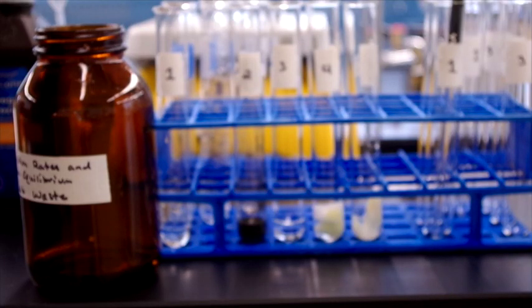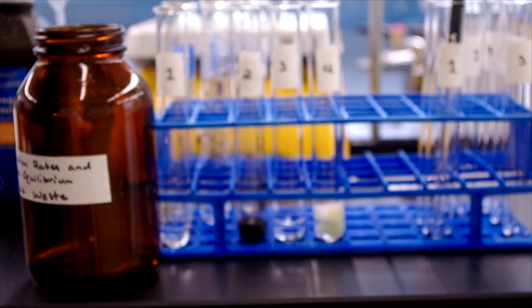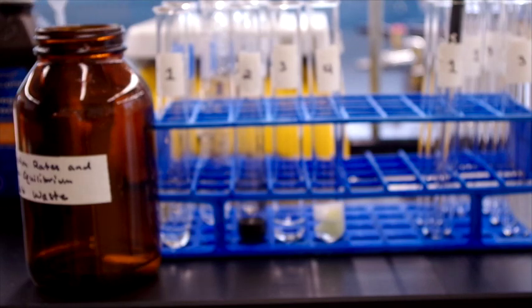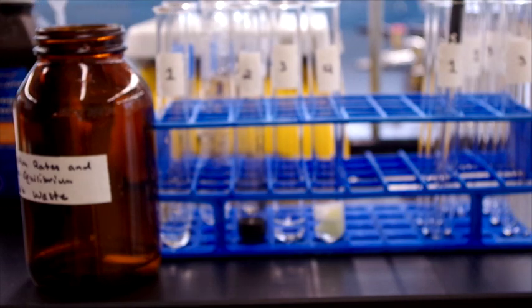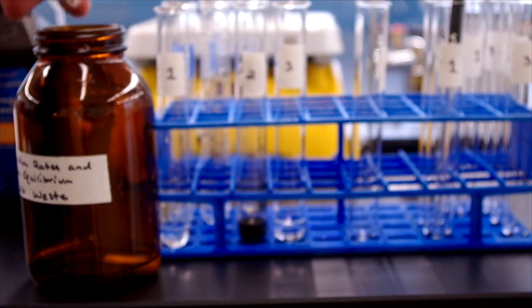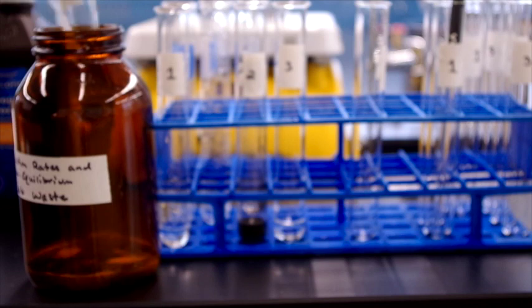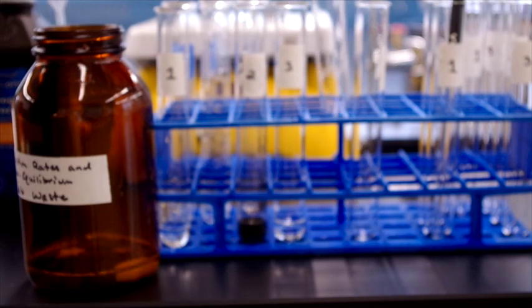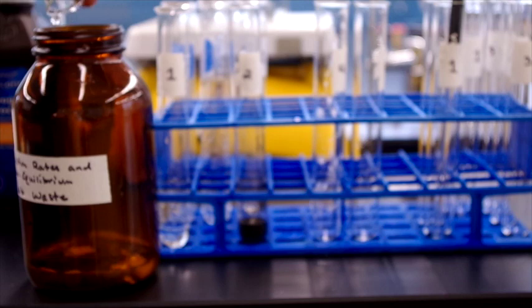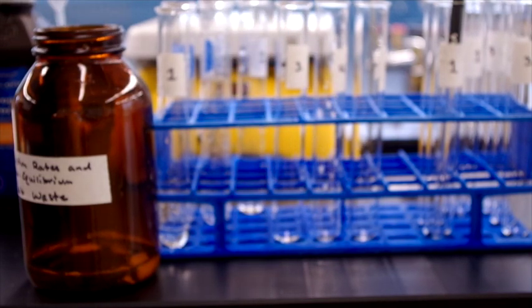As always we need to properly dispose of our waste. We take our test tube contents and pour them into this jar.